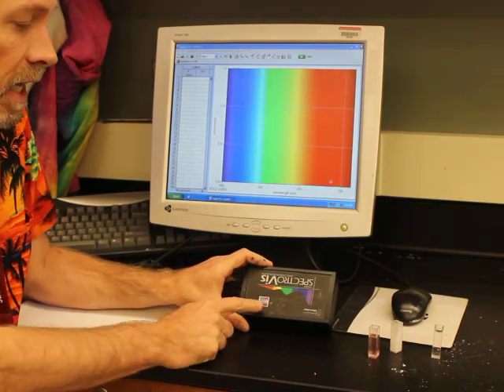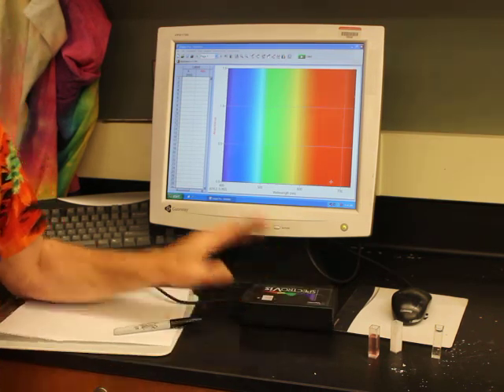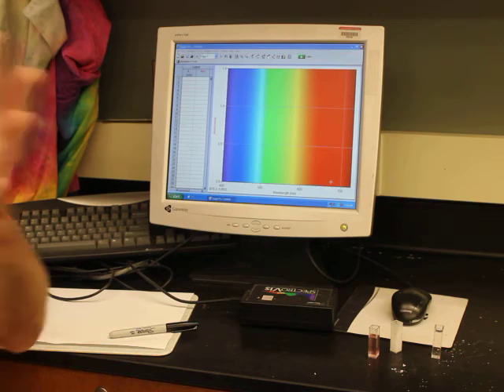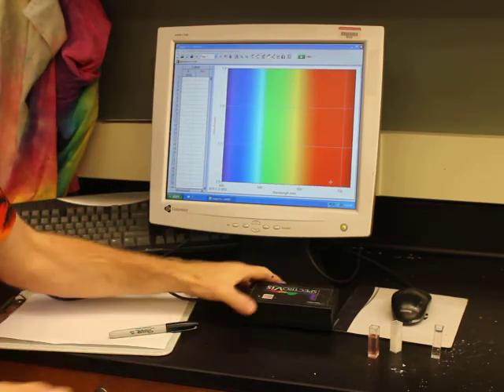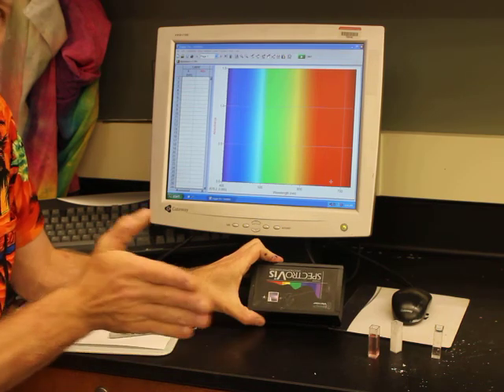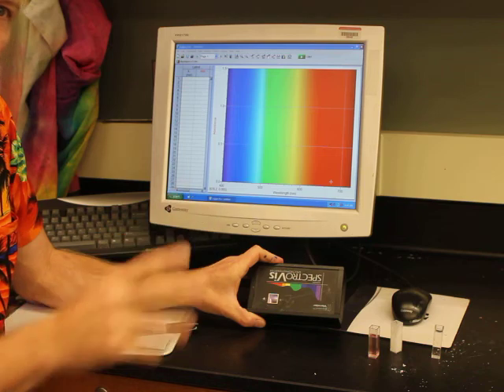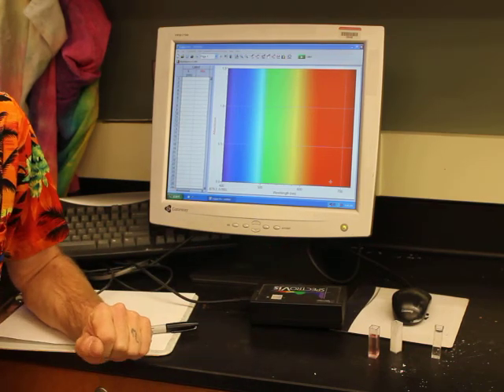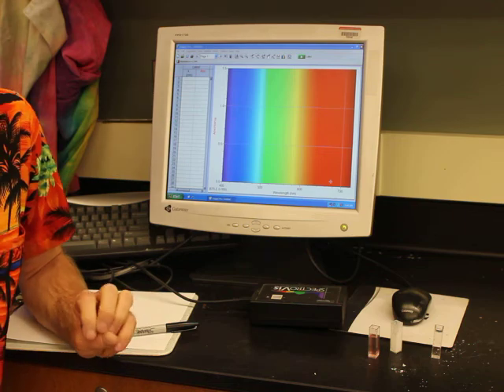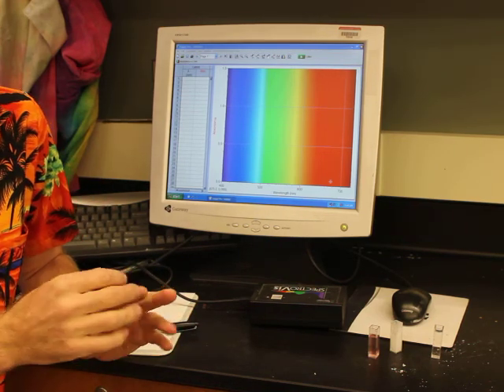Now on the other side is basically a prism, right? So remember what a prism does is it breaks our several different colors into individual colors, right? And so we basically have a little prism that is on a very quick motor, right? And then somewhere down here we have a little detector, and all that detector does is mark every time a photon hits it. It gets excited, and it just registers as an electrical signal, I've been hit by a photon, and it just counts it, right?